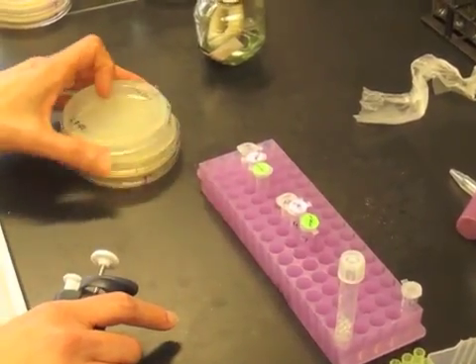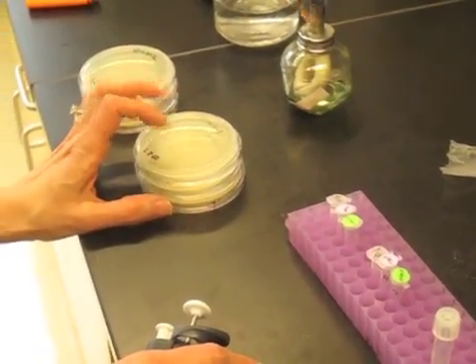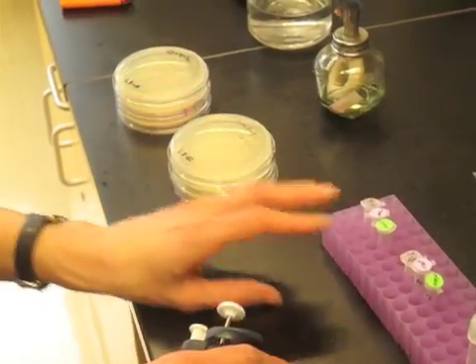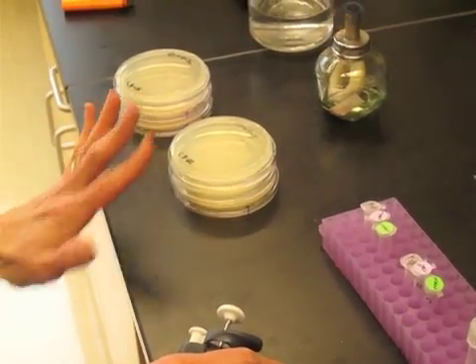So we have a total of six petri dishes, all of them have LB plus ampicillin in the media. You certainly could plate the other half of these transformation mixes onto LB with no drug and get lawns for all of the cells.